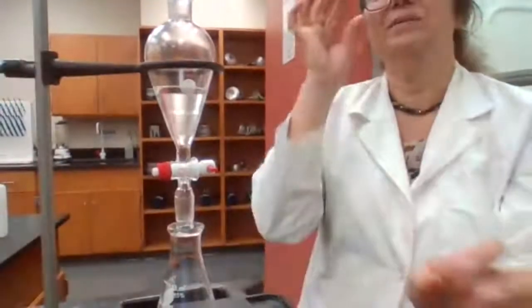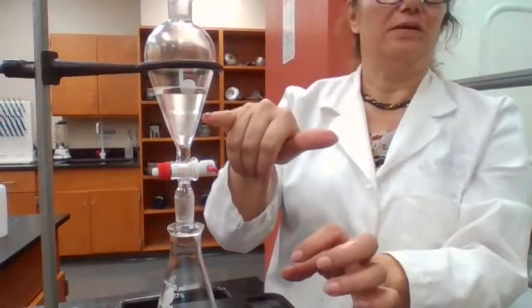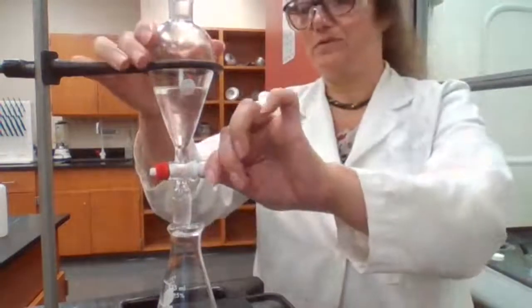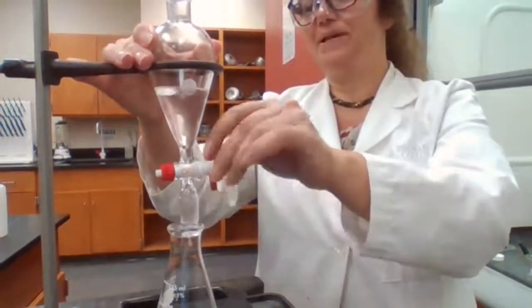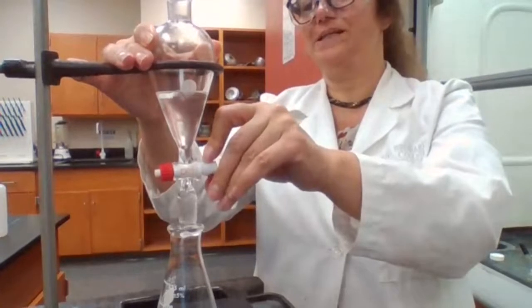Can one of you tell me if you could see the two layers? Just want to make sure. If not, I bring a black background or white background to see it. But if you can see it, that's perfect. Now we are separating the two layers. Look at the procedure to tell me what's my next step, please.